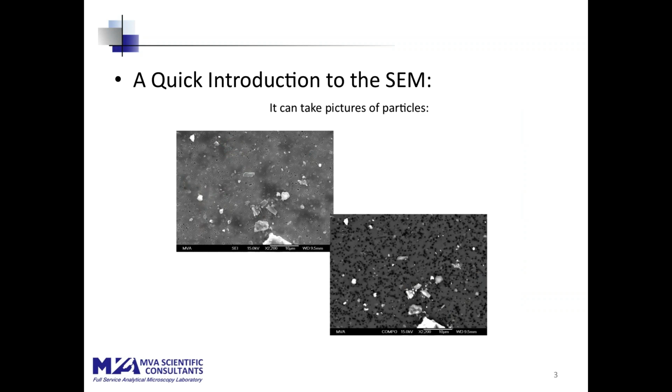So one of the things you do with it is take pictures. These are pictures of particles. There are two imaging modes that are commonly used, and you see them both here. On the left is what's called a secondary electron image, and on the right, a backscattered electron image. These are the same fields of view. The secondary electron image is formed from electrons that are given off by the sample under electron bombardment. The backscattered electron image is formed, as you might infer, from electrons that bounce off the sample. So the two different imaging modes highlight two different things. The advantage of the backscatter electron mode is that it highlights the Z contrast, or the atomic number of the particulate, so that you can see that this particulate, which is principally aluminosilicates, shows up bright against the background of a polycarbonate filter, which is principally carbon and oxygen.